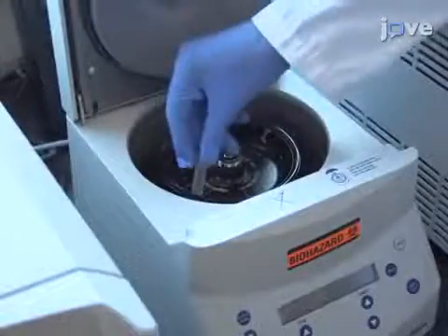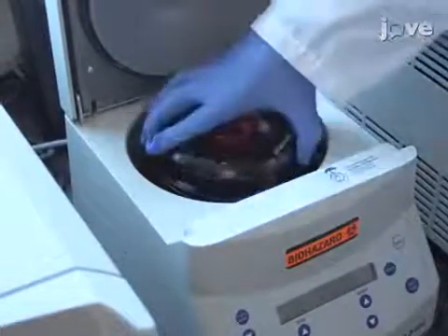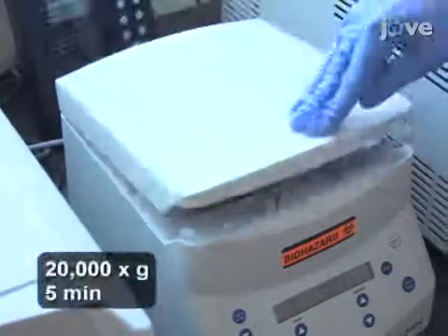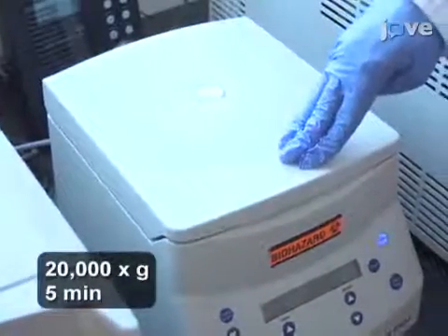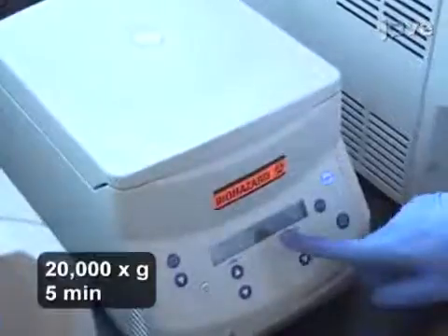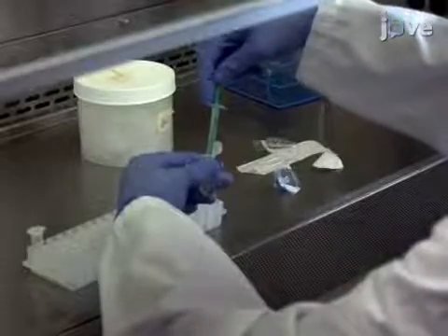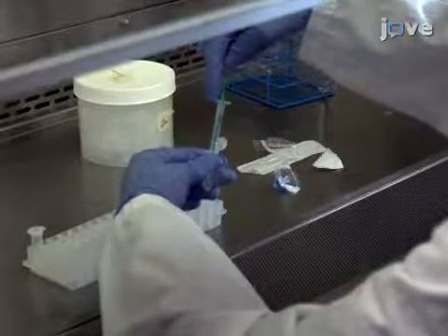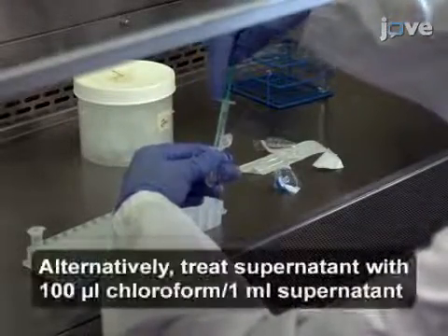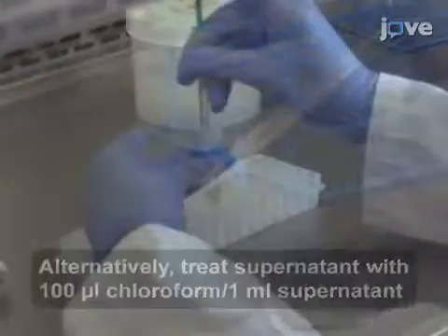The next day, pellet 1 to 2 milliliters of mitomycin C-induced cultures in a benchtop microcentrifuge. Remove and sterilize the culture supernatants by passing the supernatant through a 0.22 micrometer pore size filter.